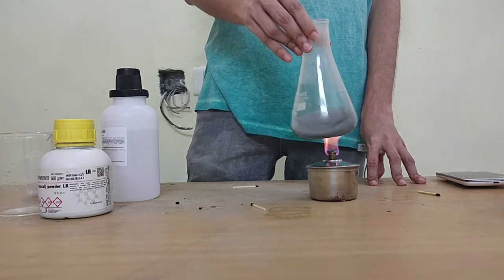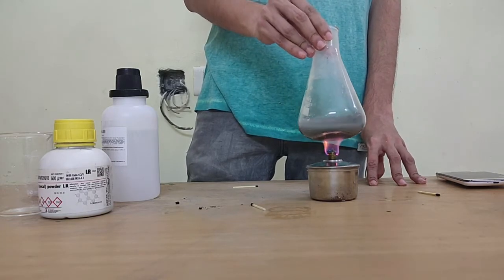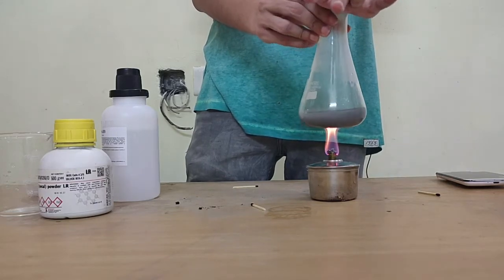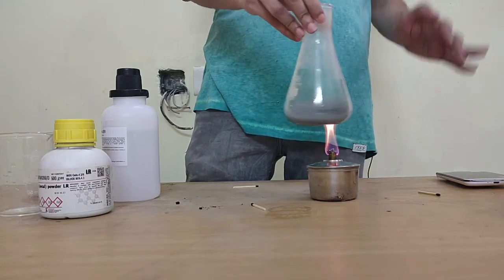In hindsight it's best to use a test tube itself because smaller mouth and you know heats quickly. This thing is big, it takes a while to heat.